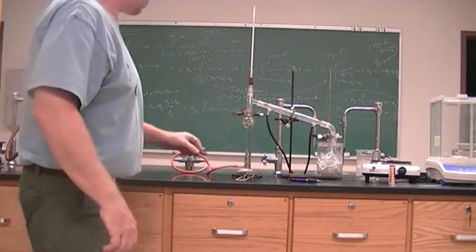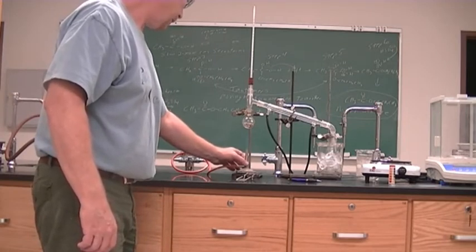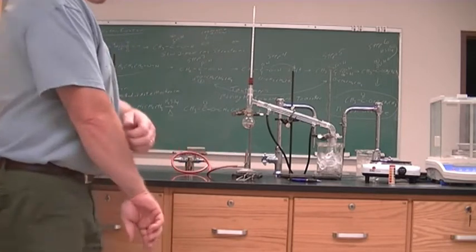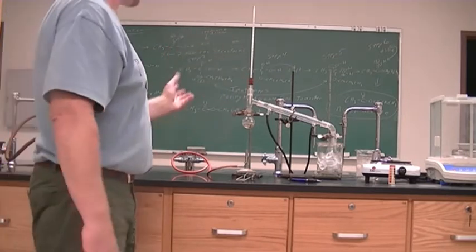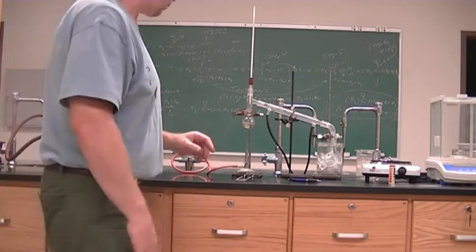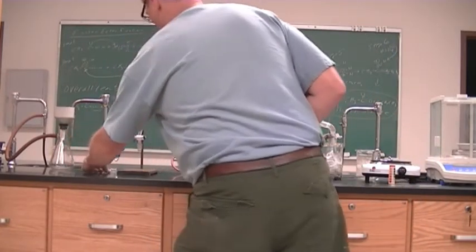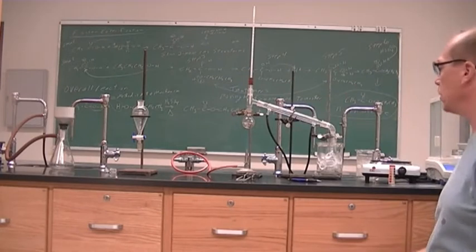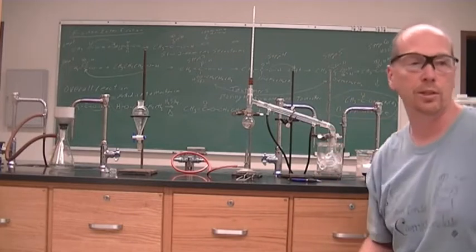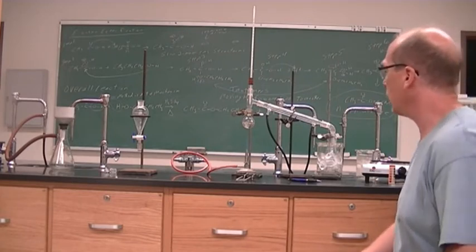All right, so we're going to get this boiling. We're going to see what the boiling point is. But this is going to boil over all the unreacted starting materials as well as the product, and then we're going to have to separate all of our different components using our separator that is ready to go right here. All right, and then it has sulfuric acid, and you can see a light tint. If you heat it too much and it's got concentrated sulfuric in there, you're going to get a nice brown, black color.